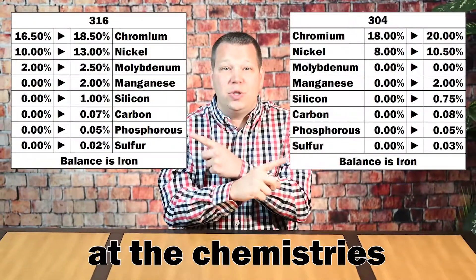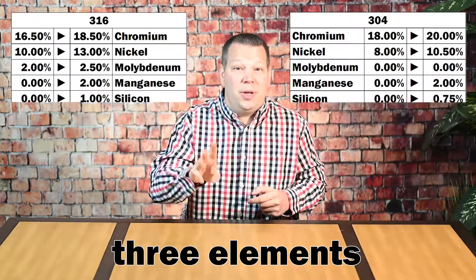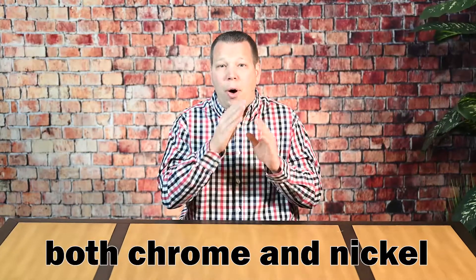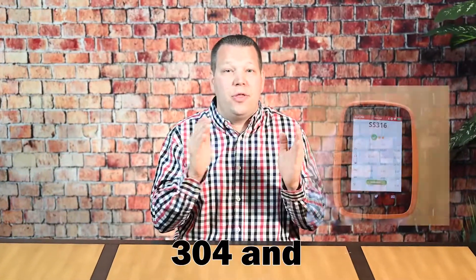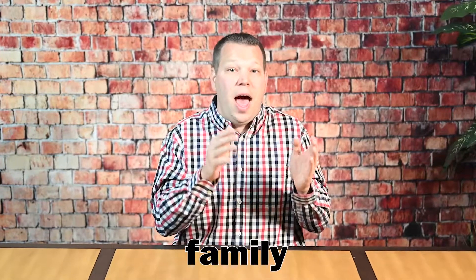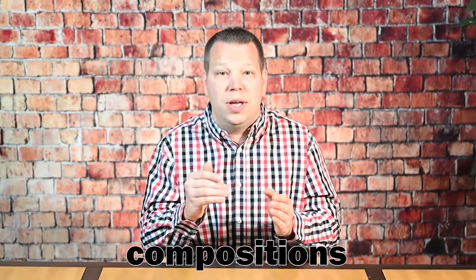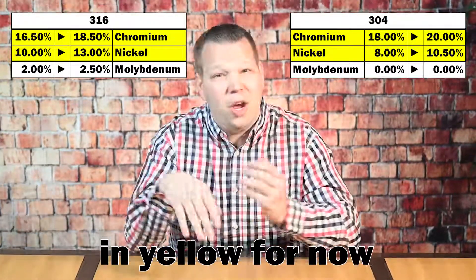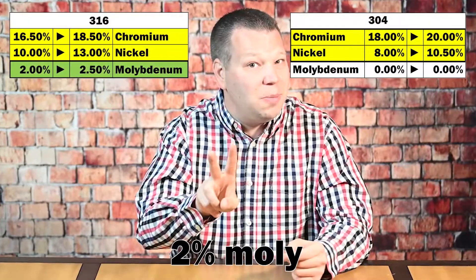As we take a look at the chemistries, we can see we really only need three elements: chrome, nickel, and molybdenum. Both chrome and nickel are important to identify the 304 and 316 stainless steel family; however, these elements have some chemical overlap between their compositions. Let's highlight nickel and chrome in yellow for now.